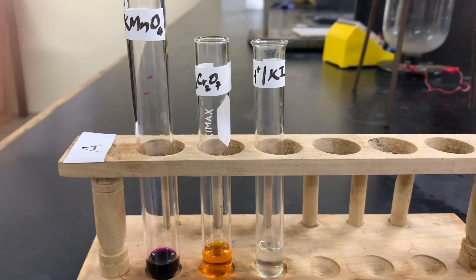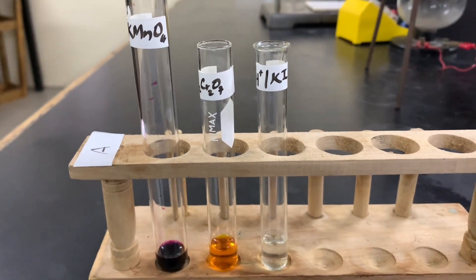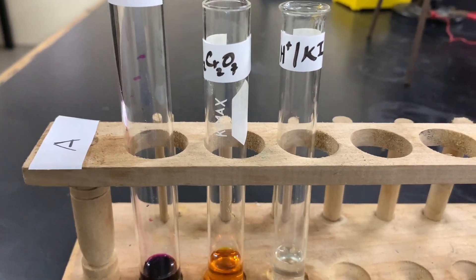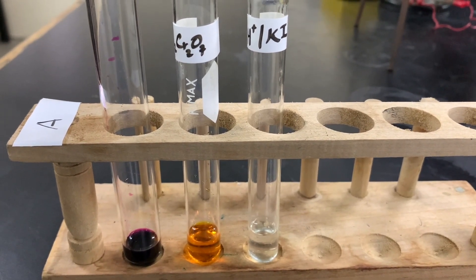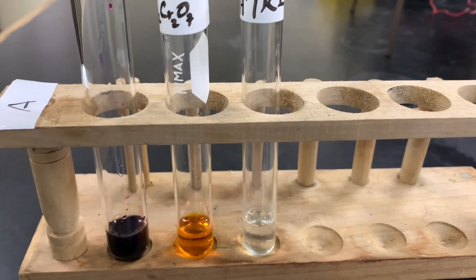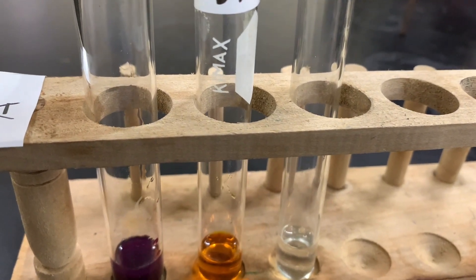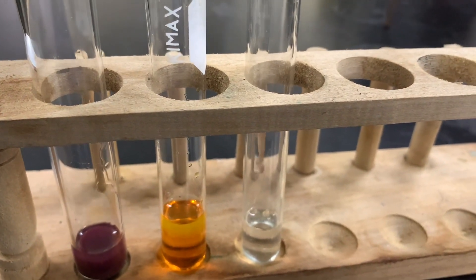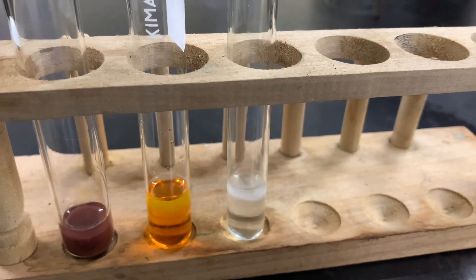We'll start by adding a small amount of A. This is the A tray, so we'll add a small amount of A to acidified potassium manganate 7. We'll come back to look at our observation. We'll add a small amount of A to acidified potassium dichromate and add a small amount of A to acidified potassium iodide.